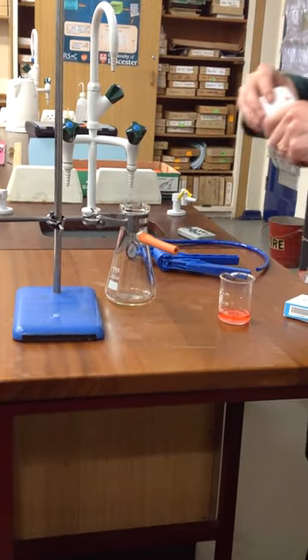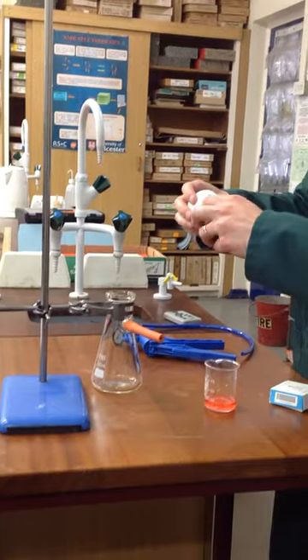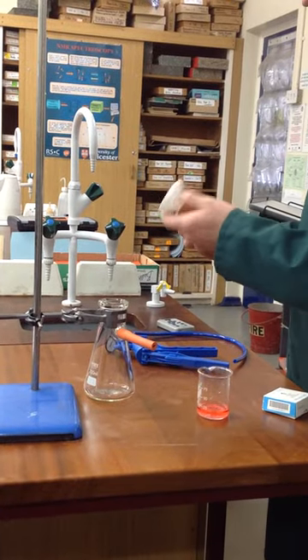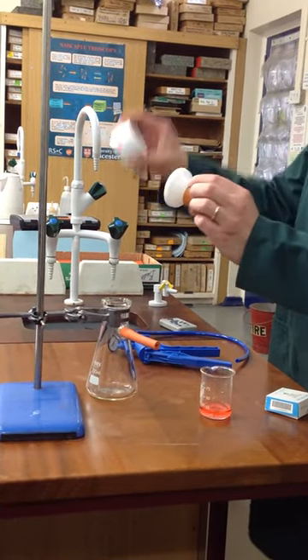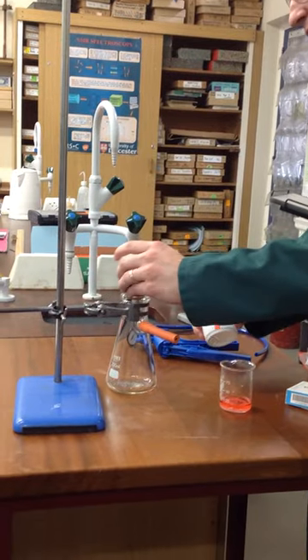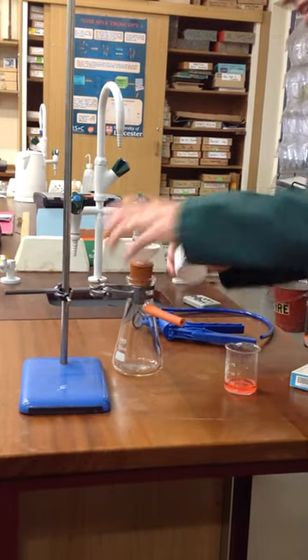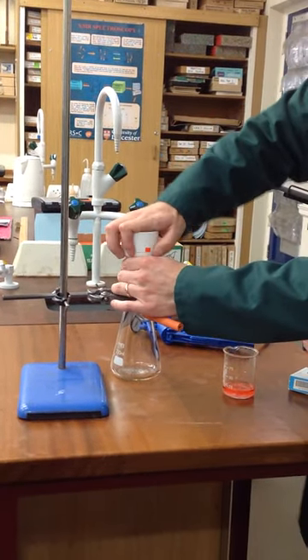What you need there is a Buchner funnel, and these will often come two parts. You've got this part here which is going to sit in there, nice seal, and then you've got the top part on here.